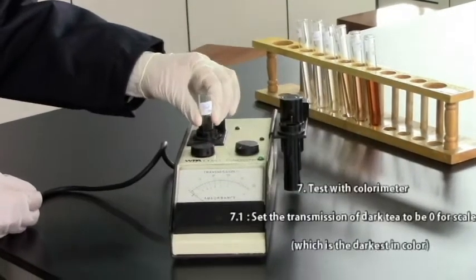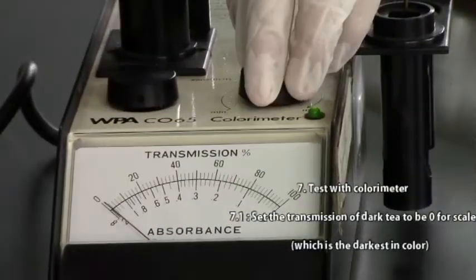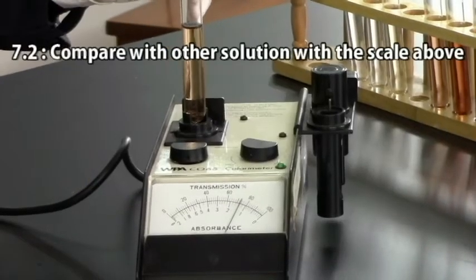Measure the light transmission of the 7 setups by a colorimeter and compare the relative polyphenol concentration of the 7 drinks.